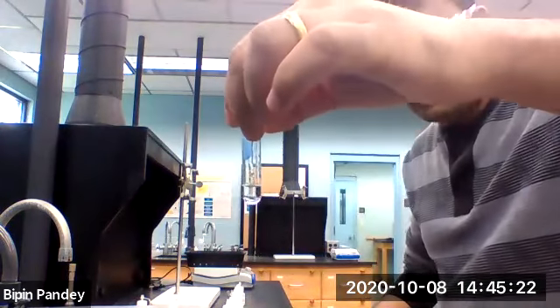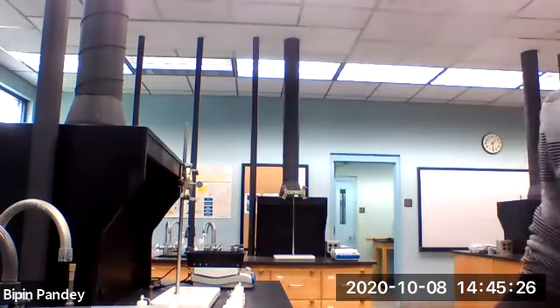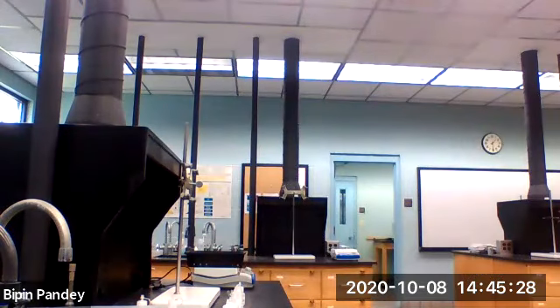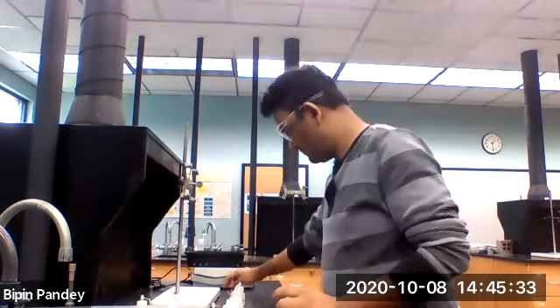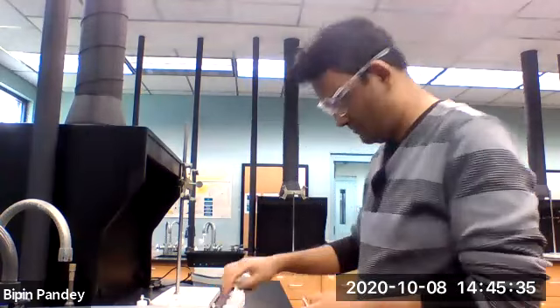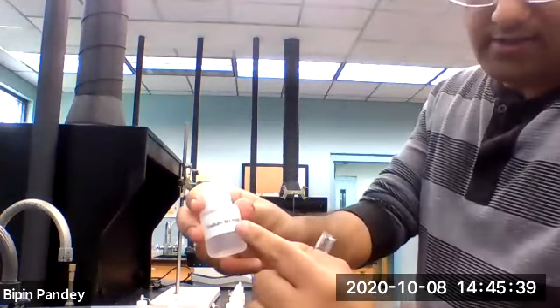You can see a clear solution. Now add sodium bromide.